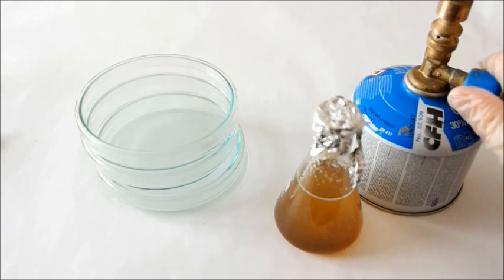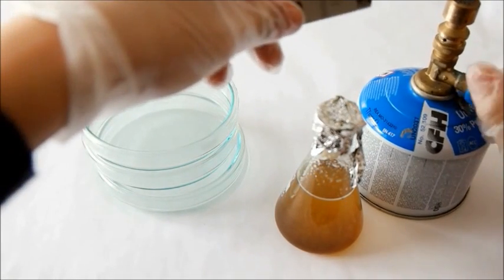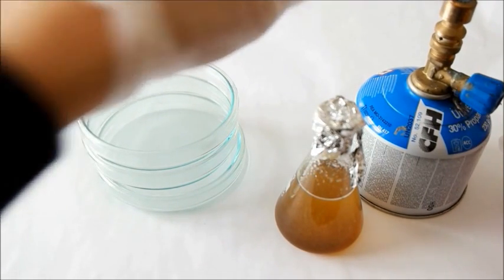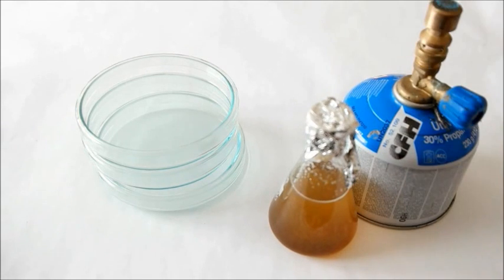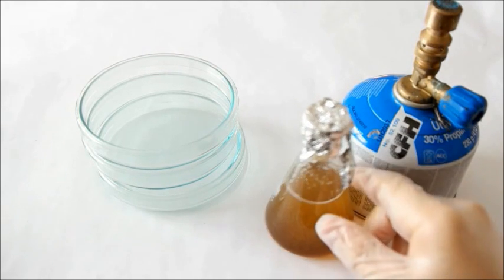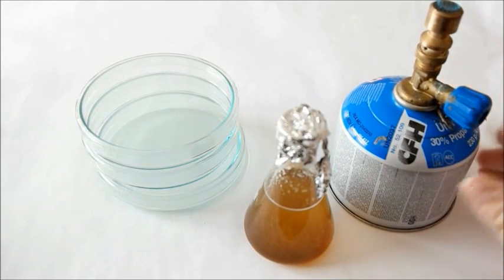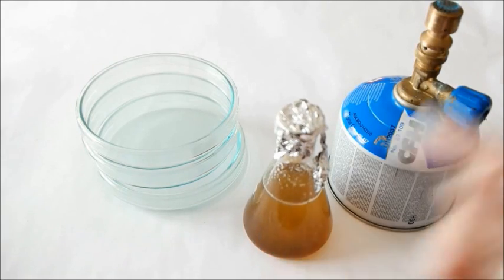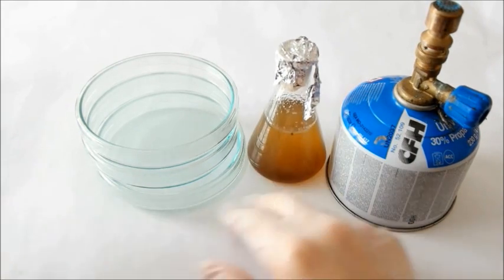Work near a Bunsen burner to prevent air contamination on your dishes because there are a lot of bacteria like Micrococcus luteus in the air which can go on your plates when you don't have fire near your working place.